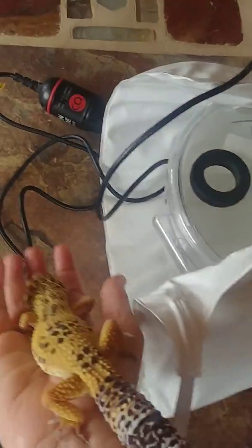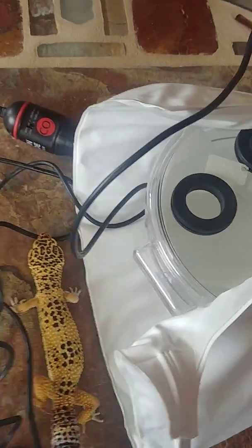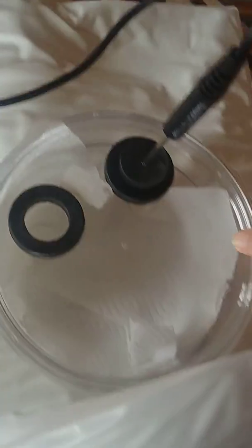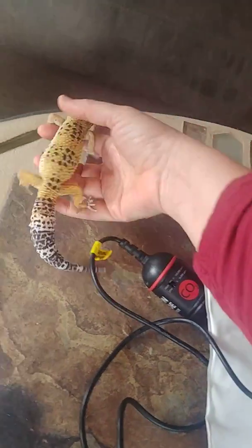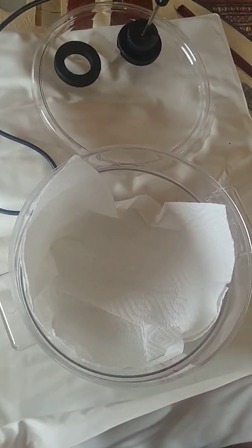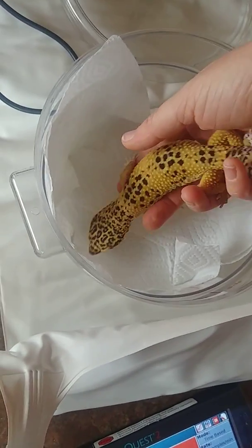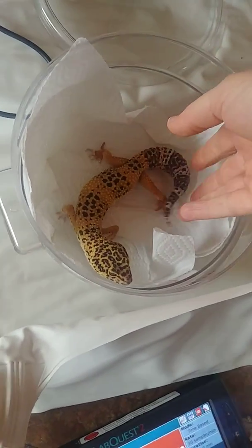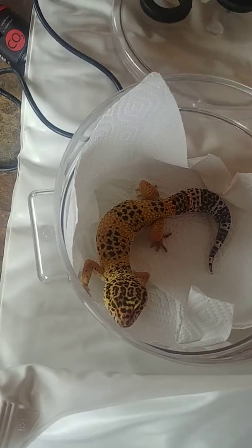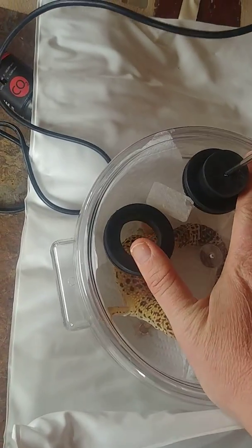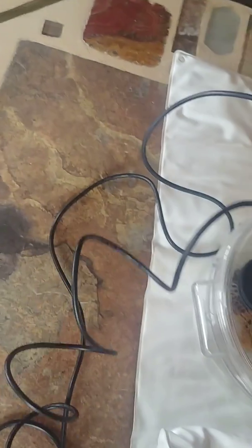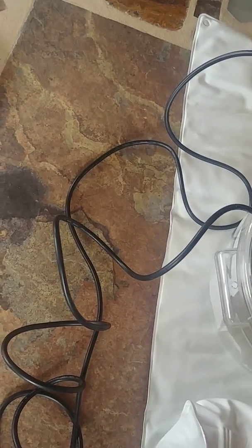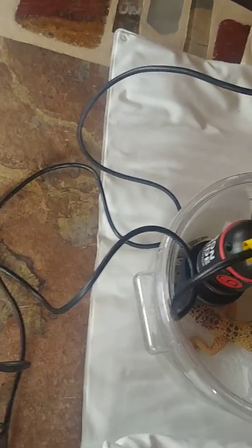All right, so hold on just a second. I got to put him down and open this up. So I put a little paper towel in the bottom of the chamber. Wallace, no escaping. To keep his toes from getting too hot because I don't want him to be uncomfortable. So we're going to put him in here. He actually usually likes the warmth and we're going to go ahead and cover this up. And we're going to put in our carbon dioxide sensor. All right. So now this is a sealed chamber.